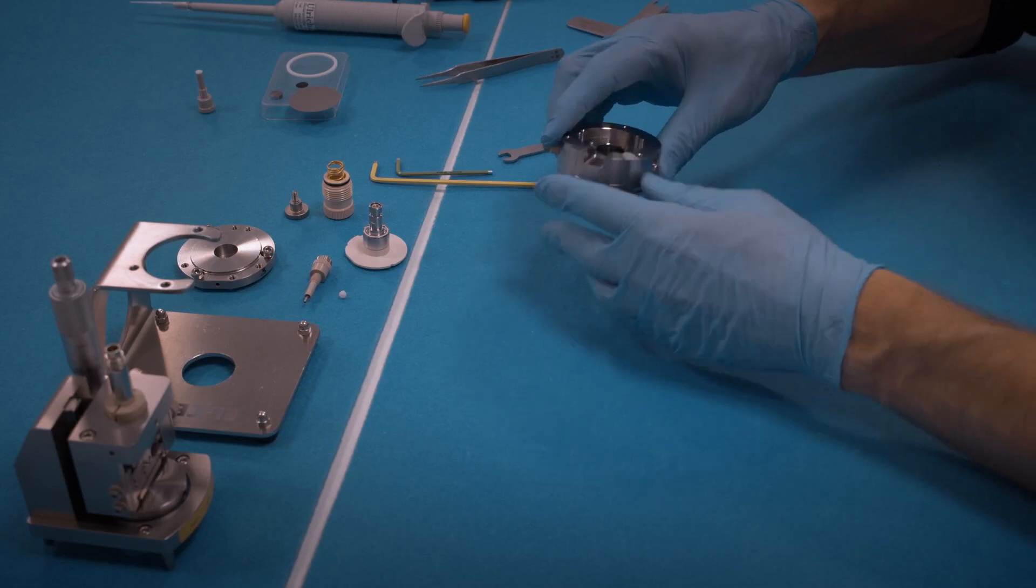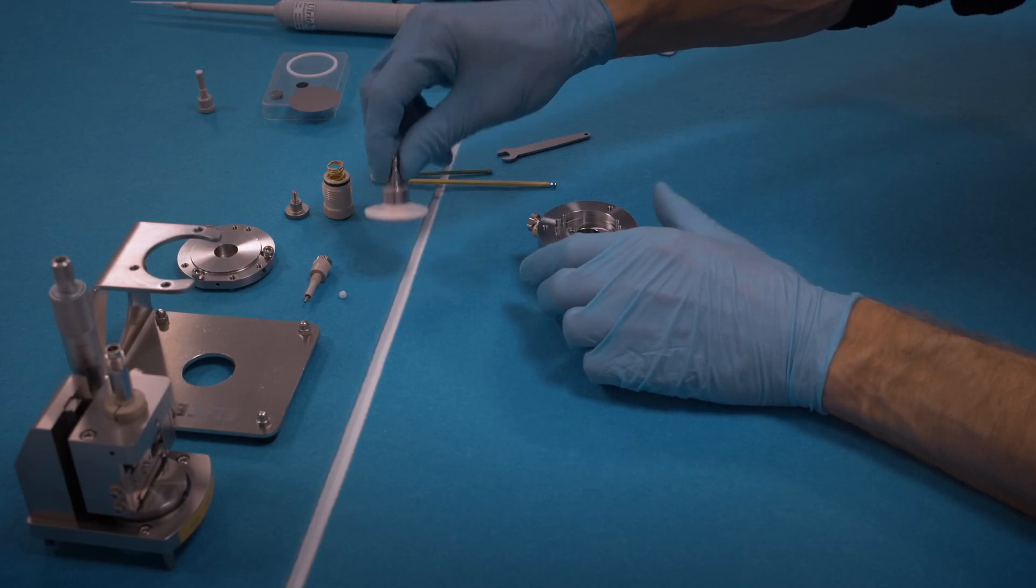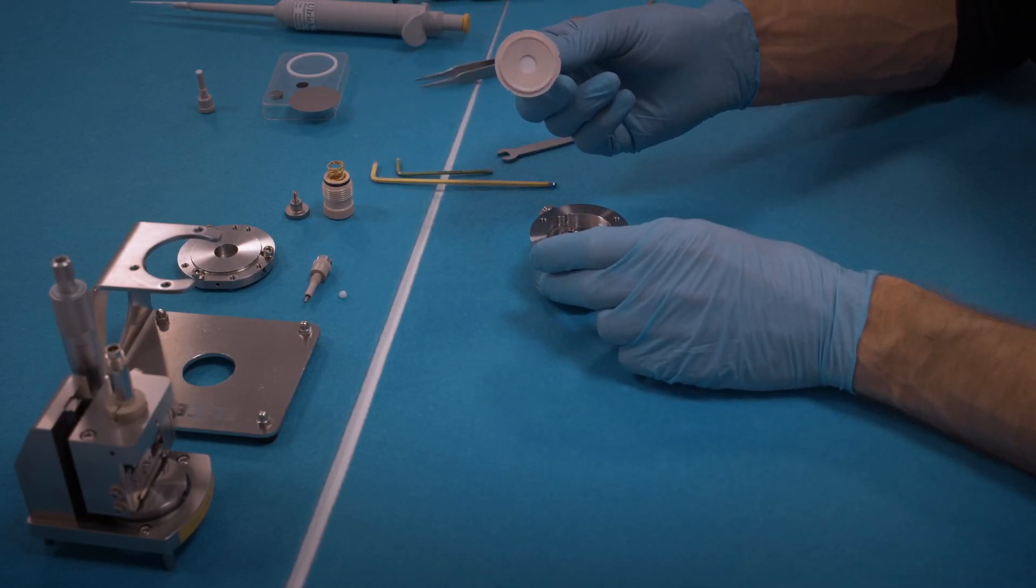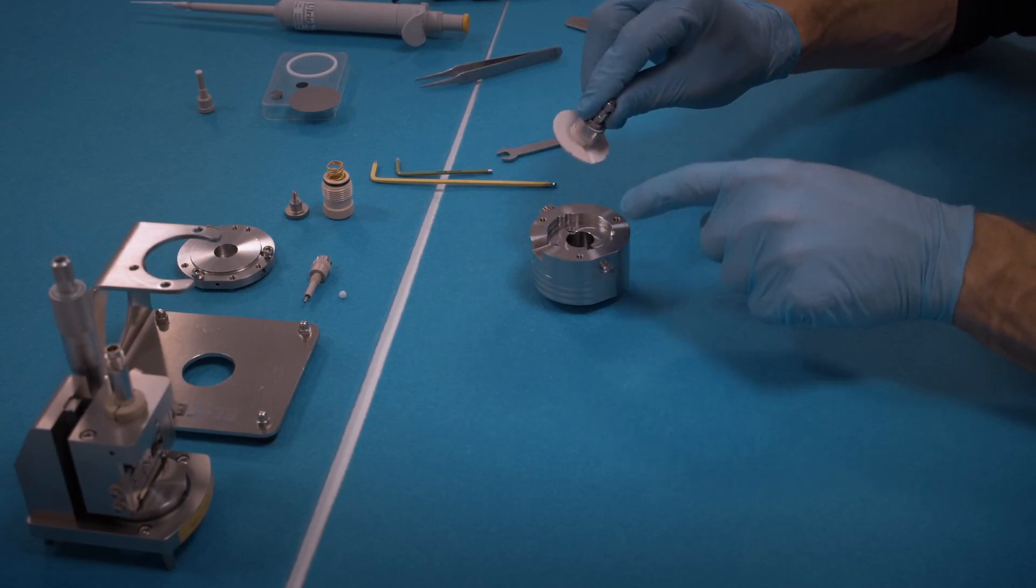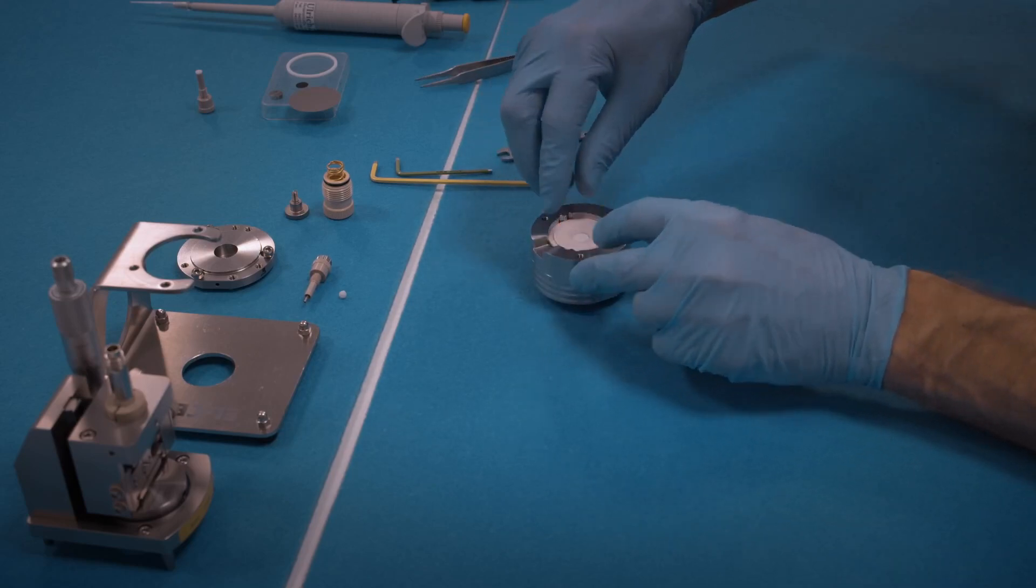Turn the assembly around and insert the frit flange with the piston, glass frit, and all the other components already inserted. Watch this groove in both the frit flange and the base which must be aligned together.